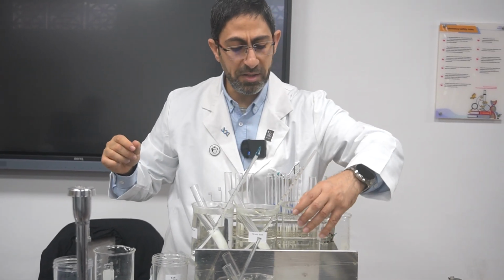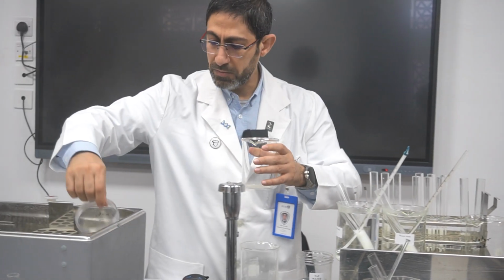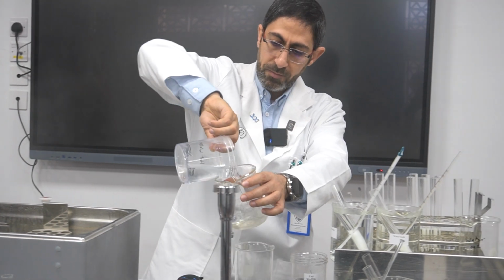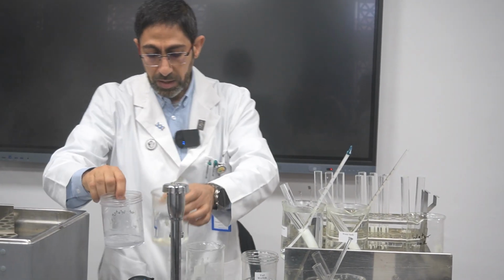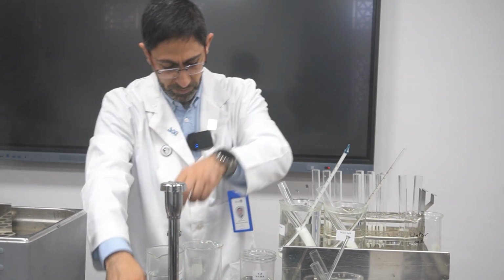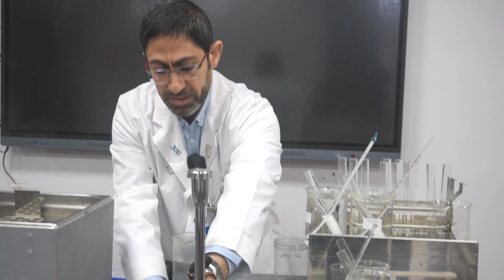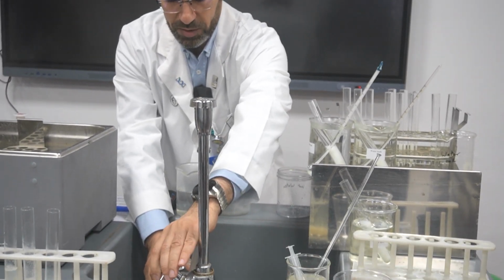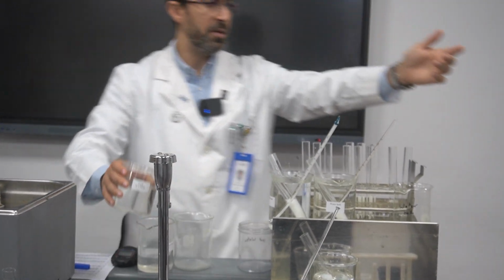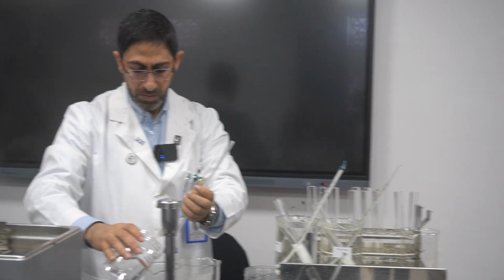Here I will make the temperature 40. I need another thermometer, please. I will be sure that cold water is ready. I need tap water. Why? Because here the temperature is really, really high. I have to decrease it to the optimum, or the temperature needed. So I need a thermometer, please. Thank you. It is 20, which is room temperature.